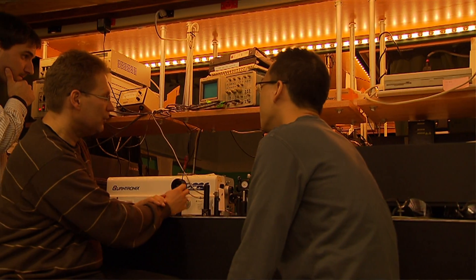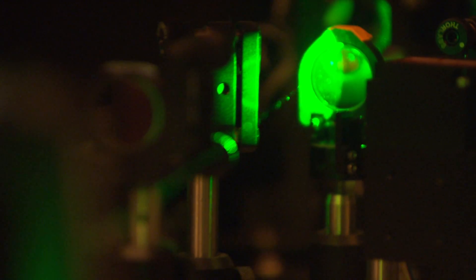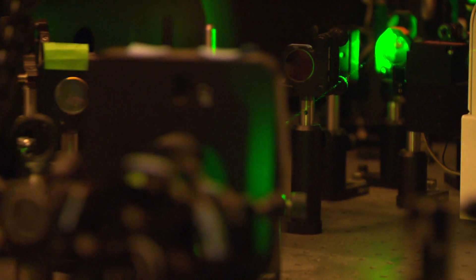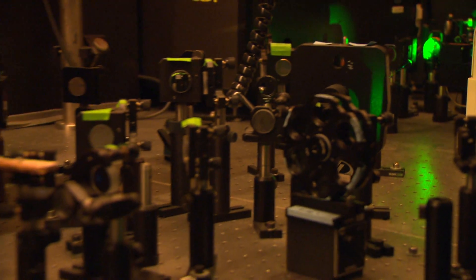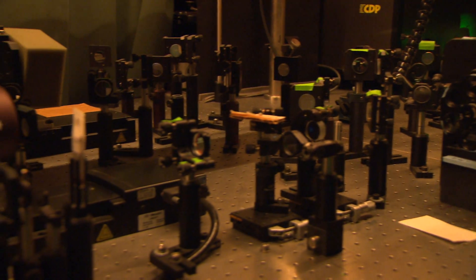Welcome to the Burda Research Group. I'm here with my graduate students Tani and Jihong, talking about femtosecond laser spectroscopy and how it contributes to uncovering the photochemical and photophysical processes in nanomaterials that are otherwise difficult to study. Spectroscopy is an incredibly versatile tool and we've been using femtosecond lasers for over a decade now to discover fundamental processes in nanomaterials and their conjugates.